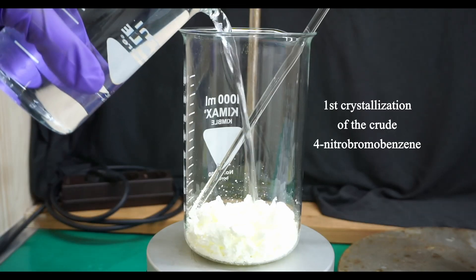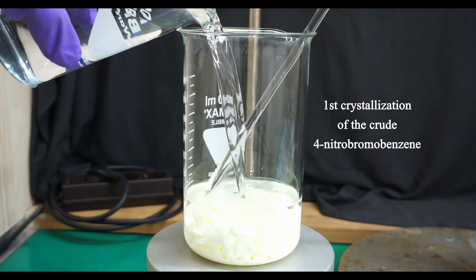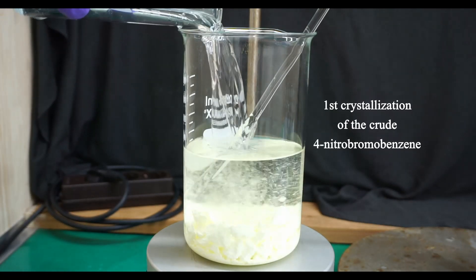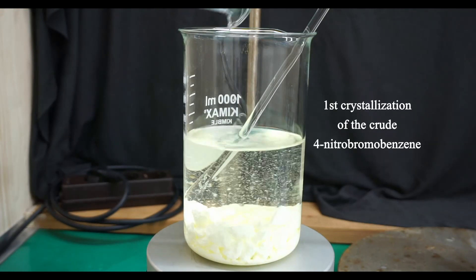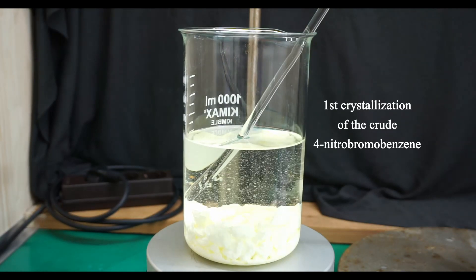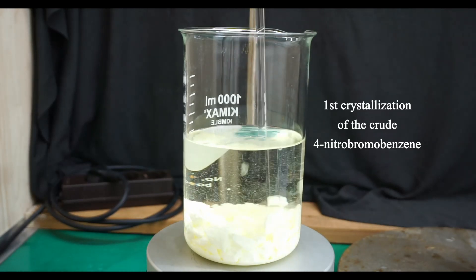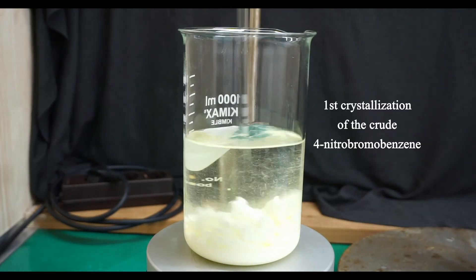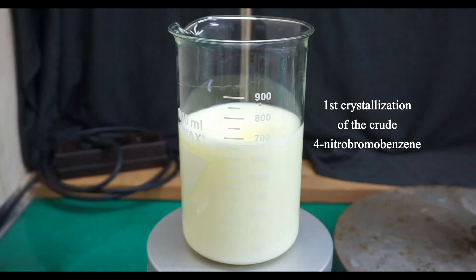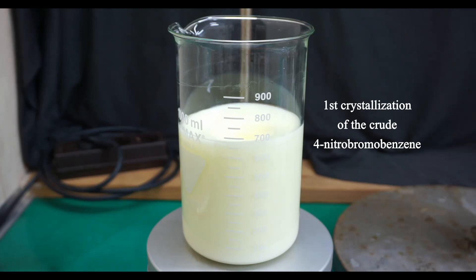The solids are not pure 4-nitrobromobenzene — they are a mixture of isomers of mononitro and dinitrobromobenzenes. I expect that the main components of the solids are 4-nitrobromobenzene and 2-nitrobromobenzene. To get pure 4-nitrobromobenzene, I have to purify this mixture by crystallization. The damp solids had a mass of 158 grams.